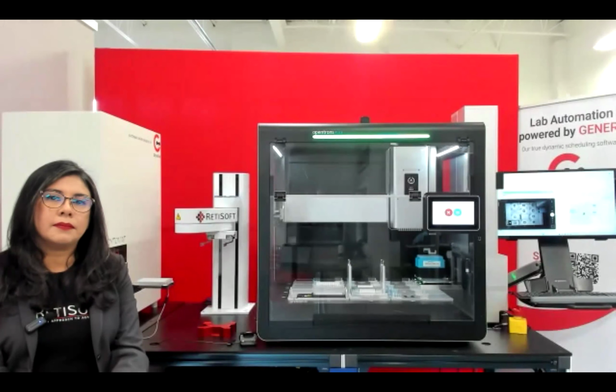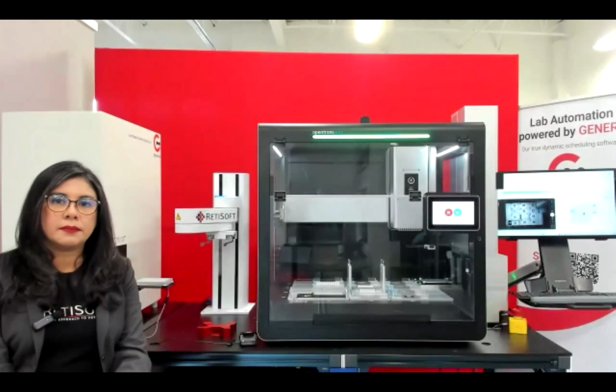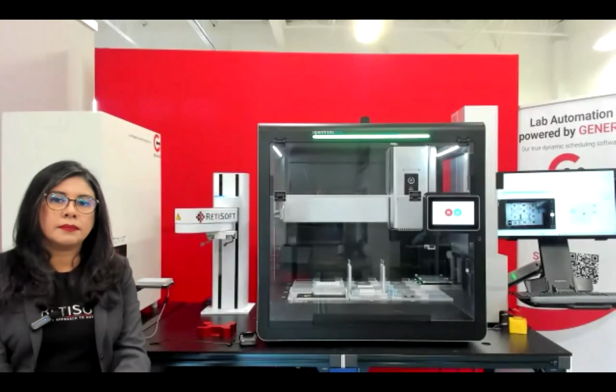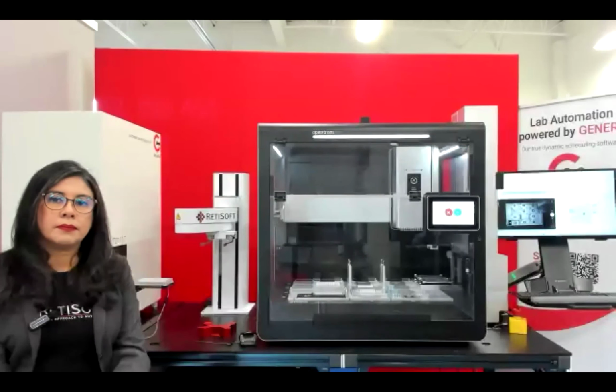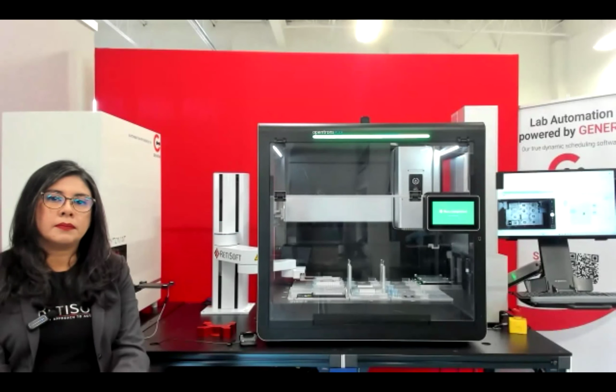Yeah, absolutely. So we have our protocol authorship and protocol revision tool, Opentrons AI. This is available for anyone who wants to navigate to it and use it to modify protocols. It's really good at revising them and performing some other functions like updating runtime parameters, which Retisoft can then interact with. This is all very directive though, from an authorship perspective.